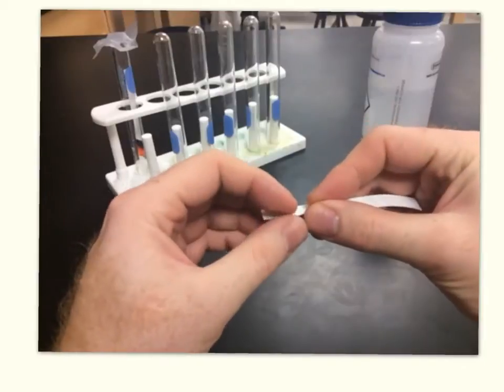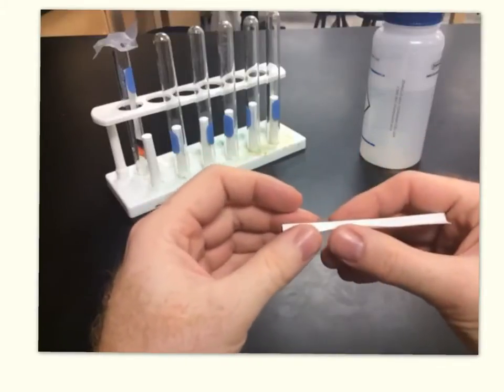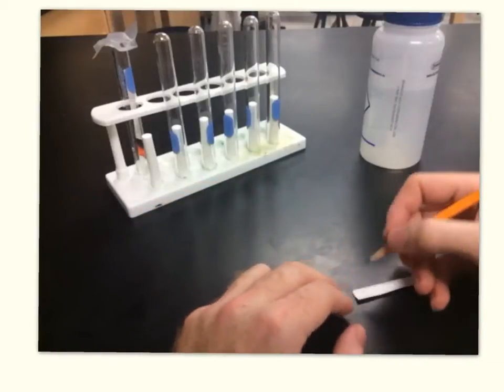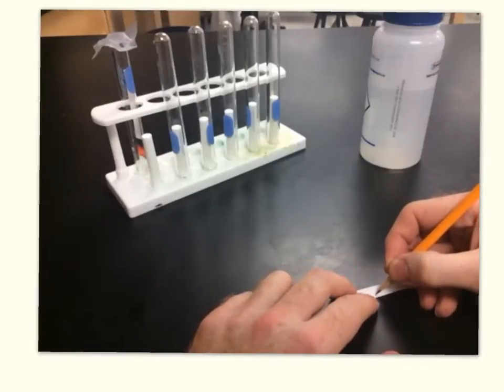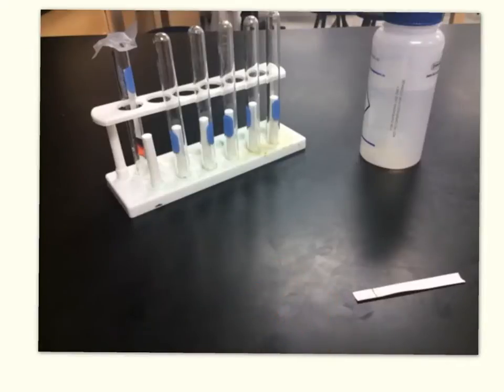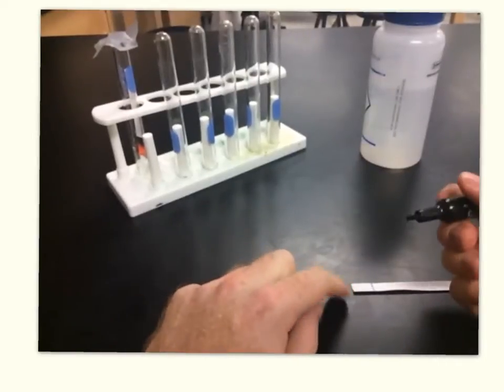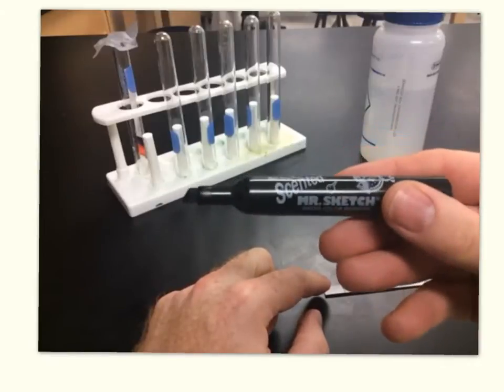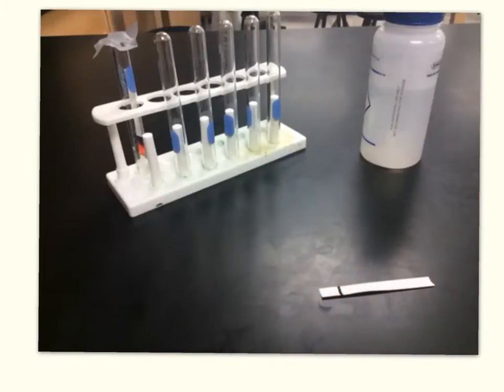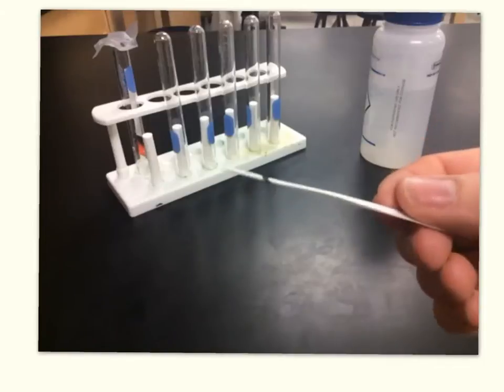I'm going to put a little crease in the middle of the paper just so it stays straight and doesn't bend and touch the sides of our container — I'm not folding it all the way, just giving it a little crease. Then I need to put a pencil line a couple of centimeters up from the bottom of the paper. That's important because I want to know where my chromatography started — the starting line for my sample. Now I'm ready to load my sample. All you're going to do is take your marker and draw a thin line right on top of the pencil line, straight across. The thinner your line, the better your separation is going to look.